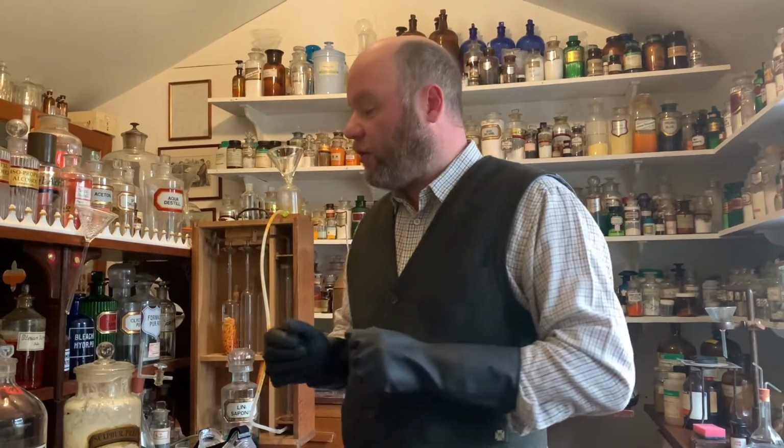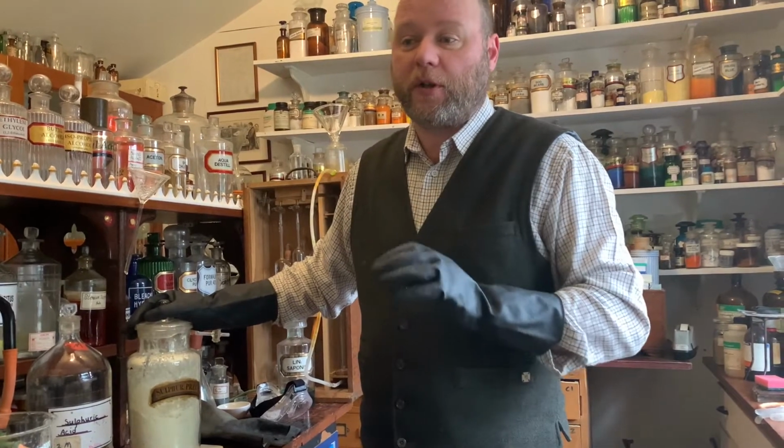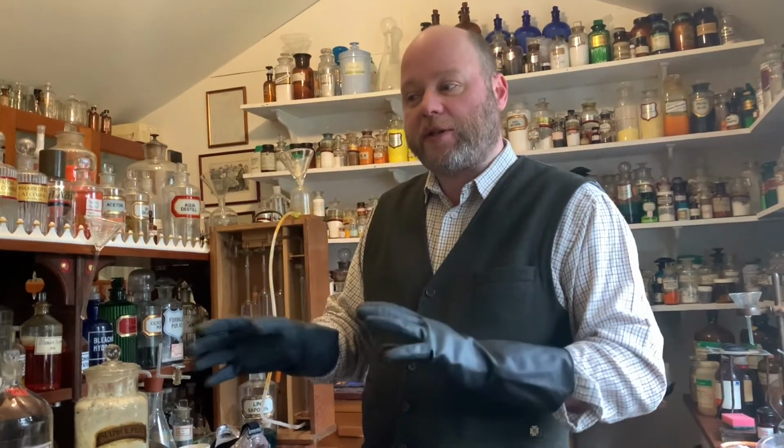Now, is assistant okay here? Yes, good. Okay, now, what we're going to do is we're going to show you in the fume cupboard some experiments using concentrated sulphuric acid, and I'm going to explain to you why it's so dangerous and maybe some safety principles you can use if you're handling concentrated sulphuric acid.